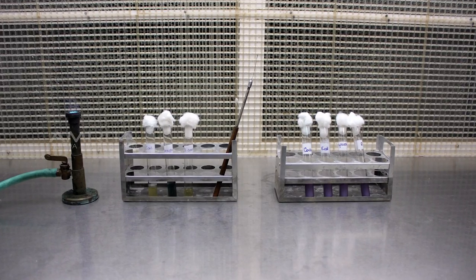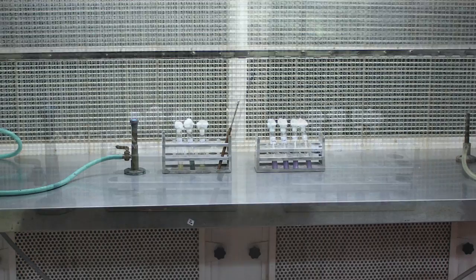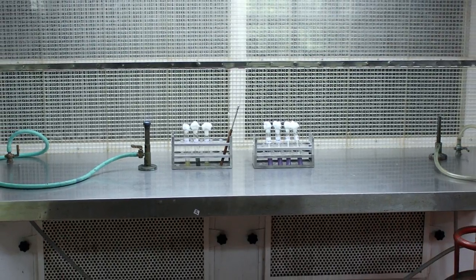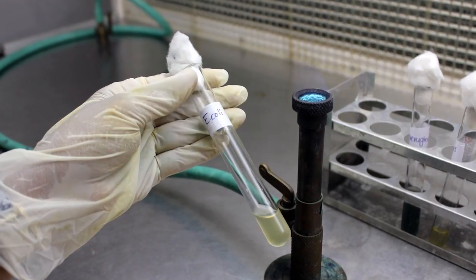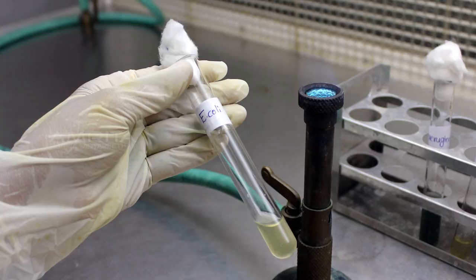Procedure: Arrange all the cultures and media in the laminar airflow. Take Tryptic soy broth from the rack containing 24-hour culture.